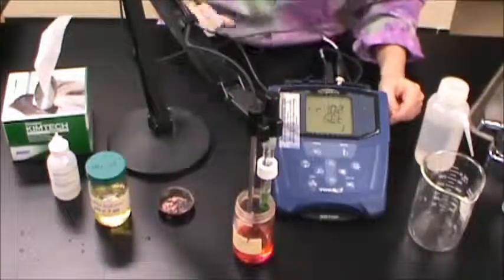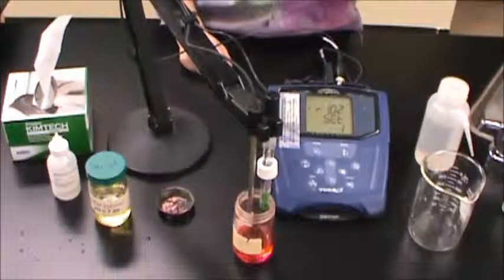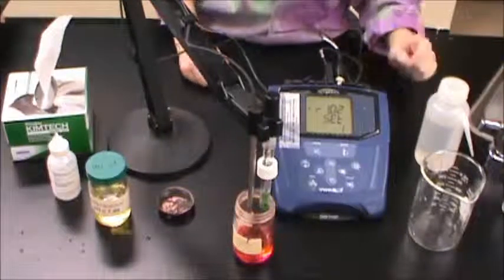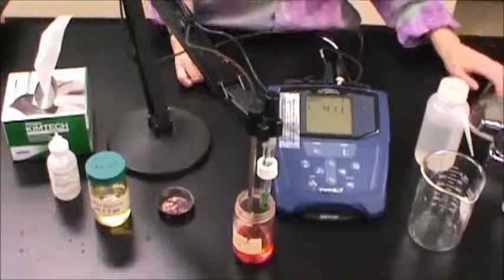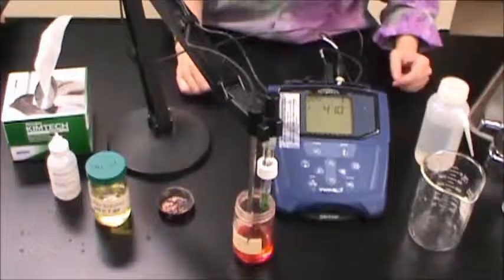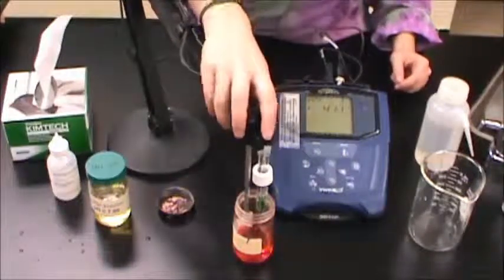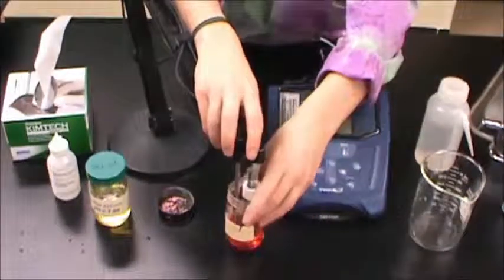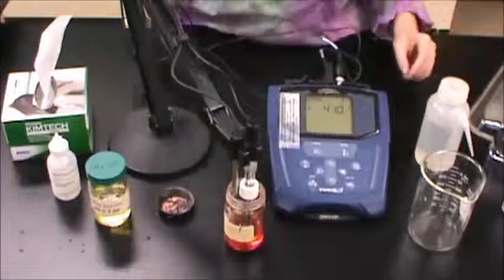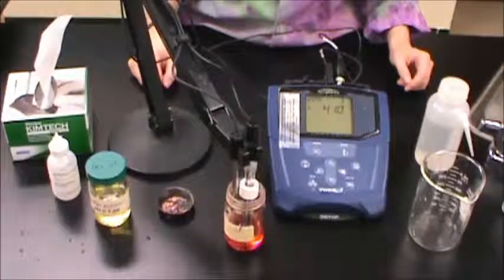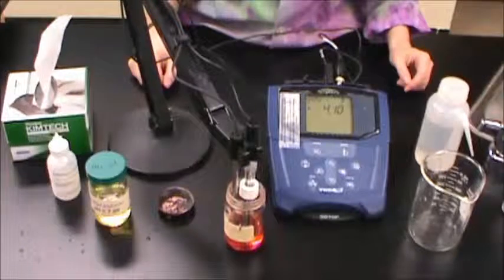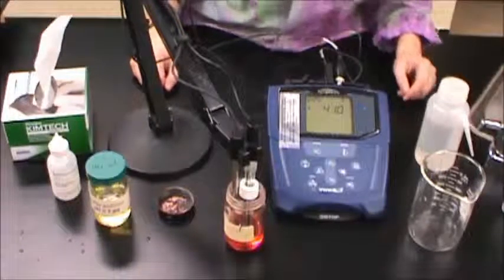Press the on button to turn on the instrument. Allow the probes to sit in the buffer solution for about a minute before entering calibration mode.